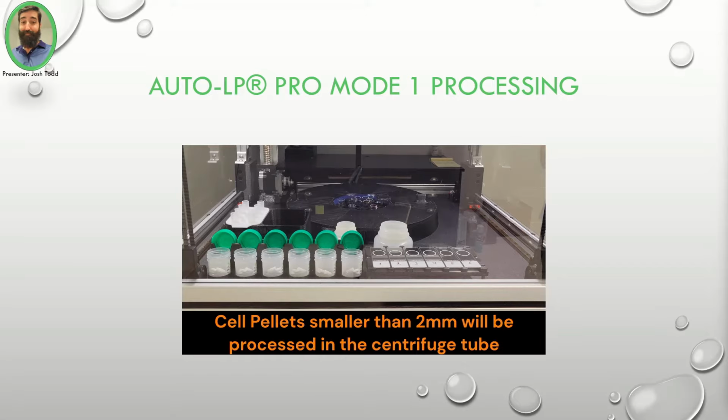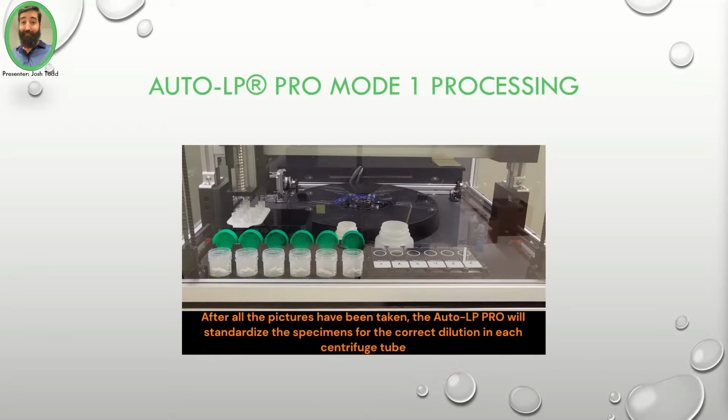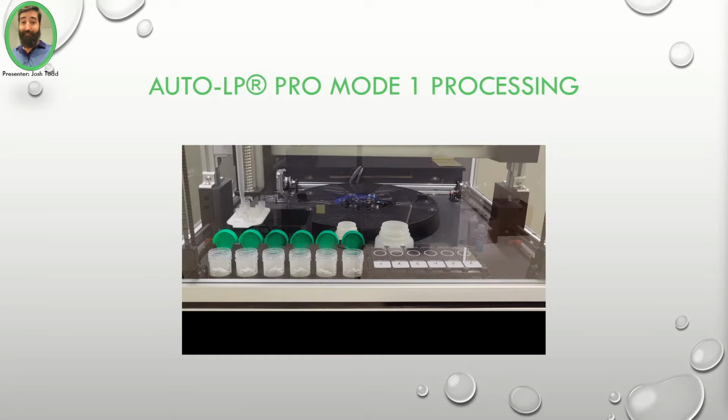Cell pellets smaller than 2 millimeters will be processed in the centrifuge tube. Pellets larger than 2 millimeters will be processed in the working tube. After all the pictures have been taken, the AutoLP Pro will standardize the specimens for the correct dilution of each specimen.